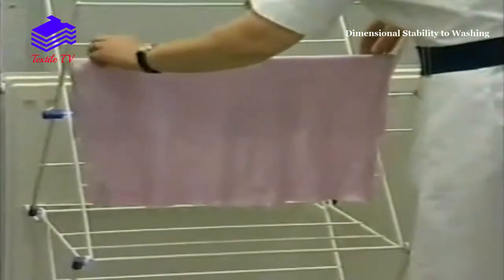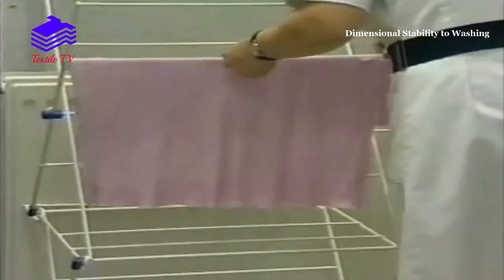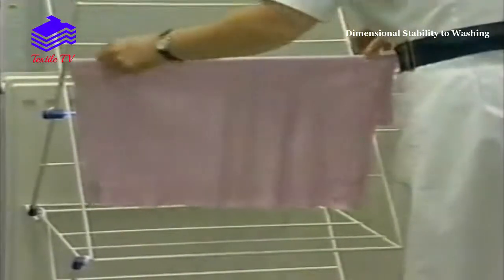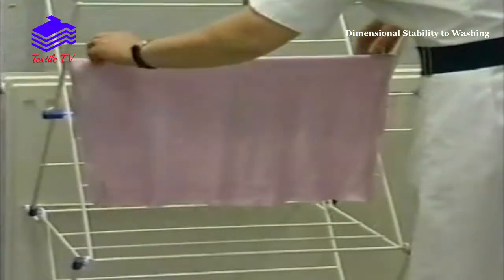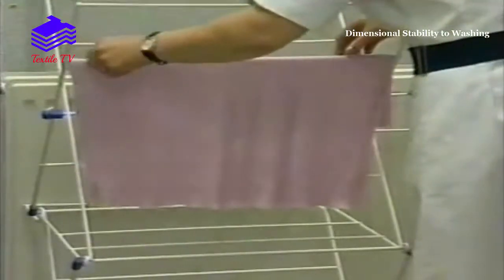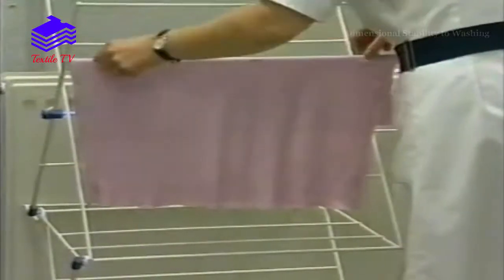Whichever drying method is used, when the specimens have dried, they are re-measured and the dimensional change calculated.